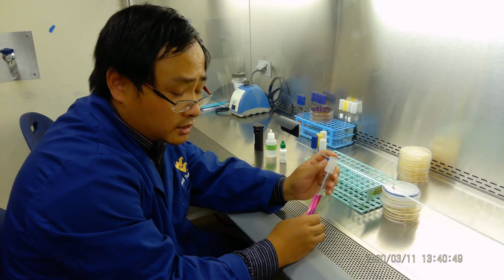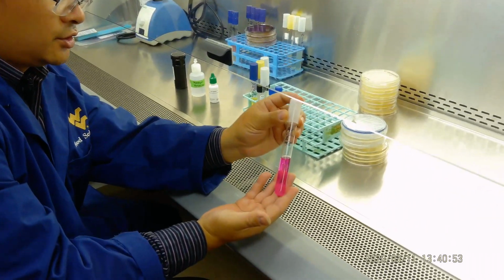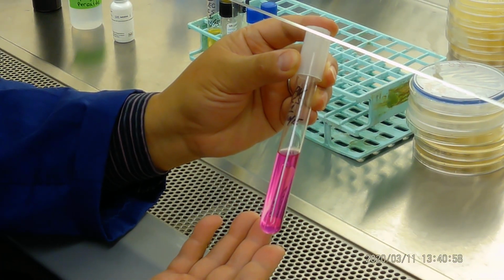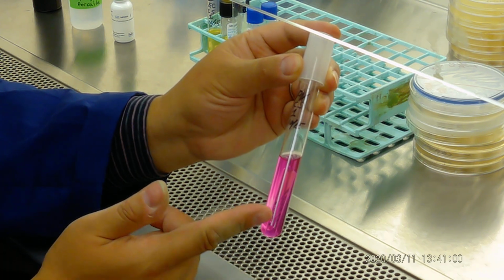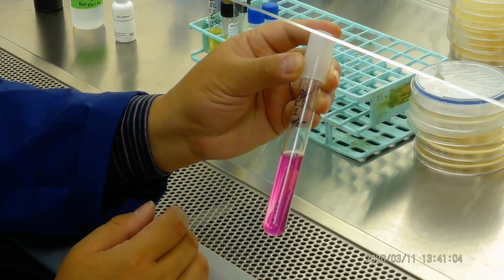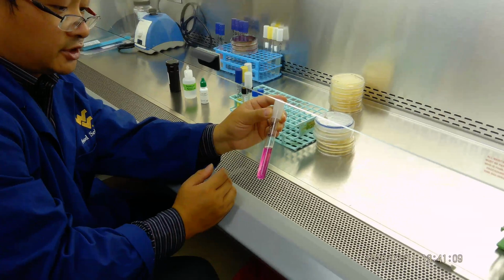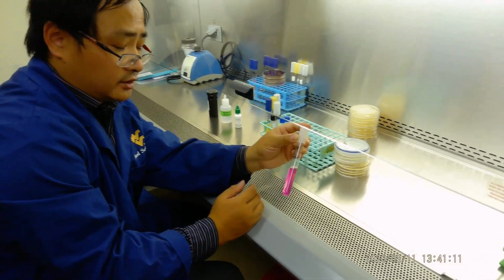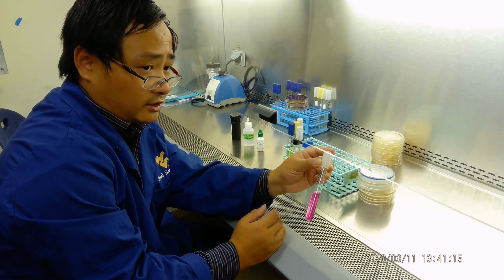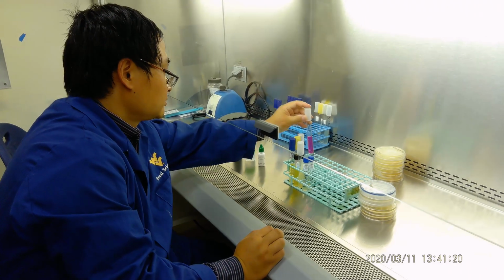Let's look at some of the results from last week. The first is a urea test. You can see here the urea test looks pink and cherry red. This is positive. Which bacteria is this? It is Proteus vulgaris, because the pH indicator phenol red, in an alkaline environment, will become cherry red. Urea is broken down by urease into ammonia and carbon dioxide, and ammonia is a weak alkaline. Okay, so that's the first one.